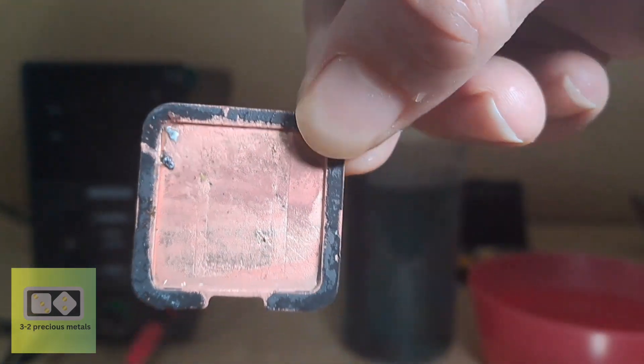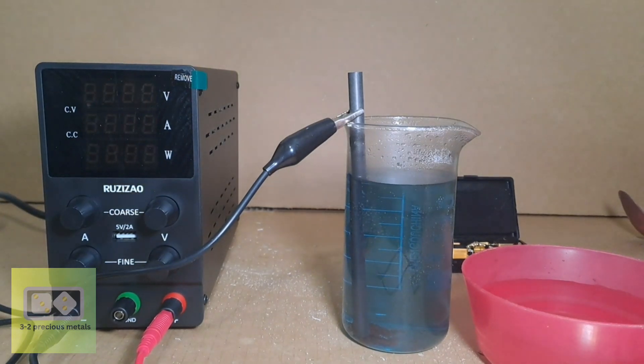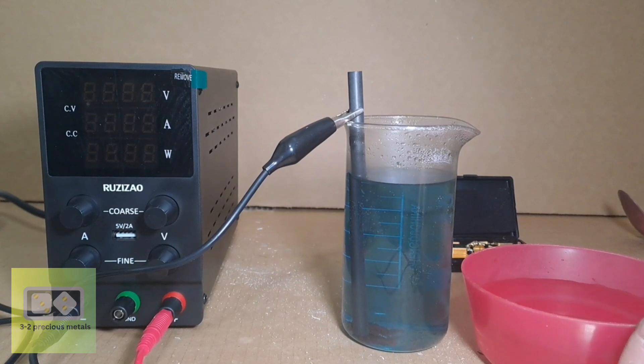So the next question is, is sodium bisulfate a viable alternative to using sulfuric acid? Let's take a look and see what happens.